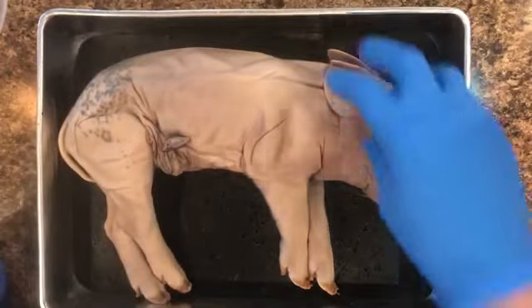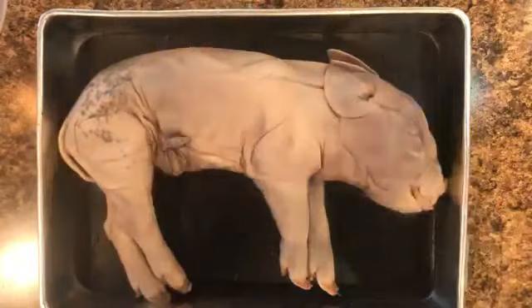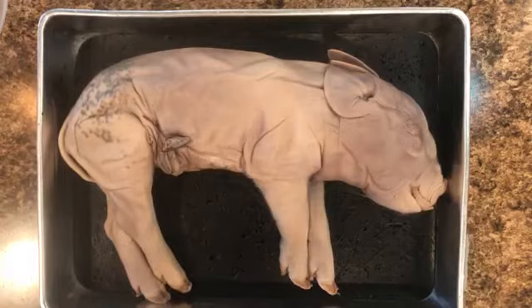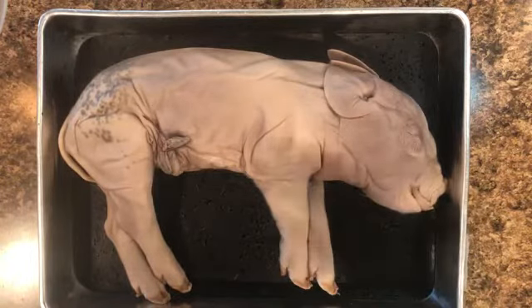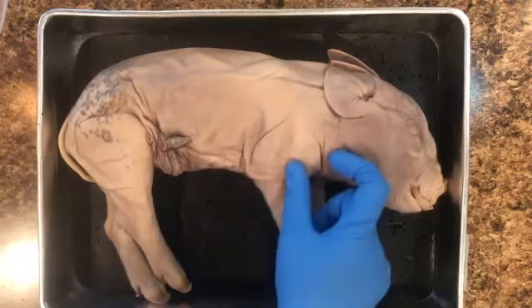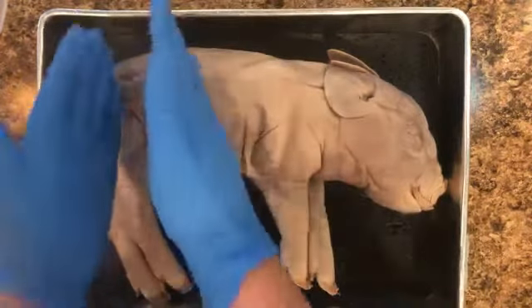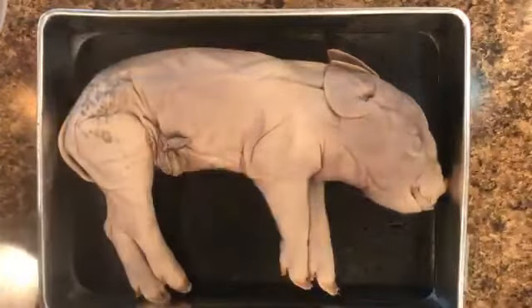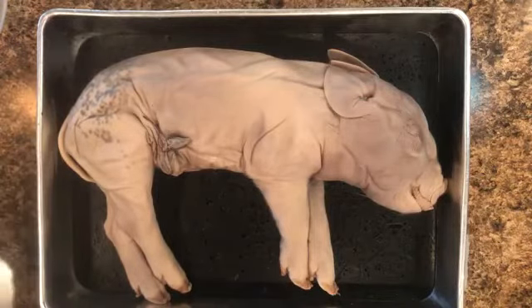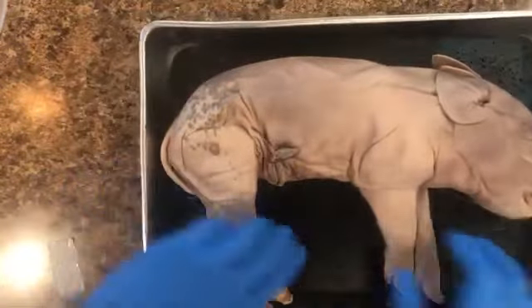Up here, this region right here is the pectoral region. In us, it would be our chest, our pectoral girdle. If you are a weightlifter, your pecs or your chest muscles. The thorax is right here. And then you also have the trunk. The trunk region is down this way, and then the pelvic region. So here's your pelvic region, just like your own pelvis, your hip bones and things of that nature. Hopefully this all goes well today and you can see all this very clearly.